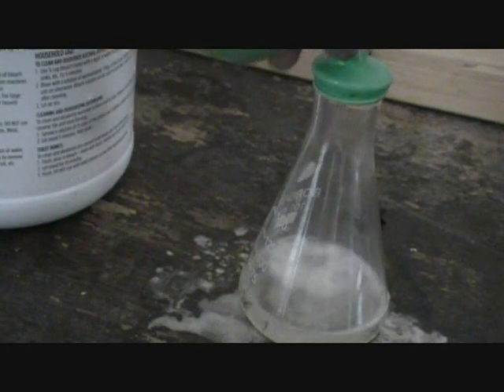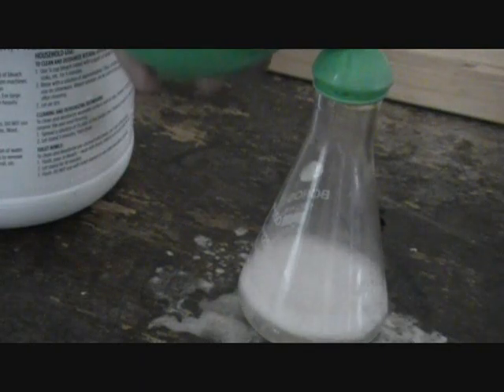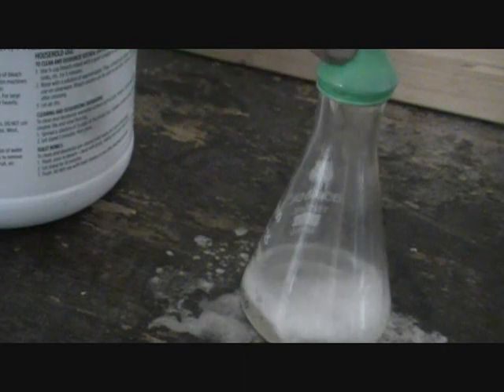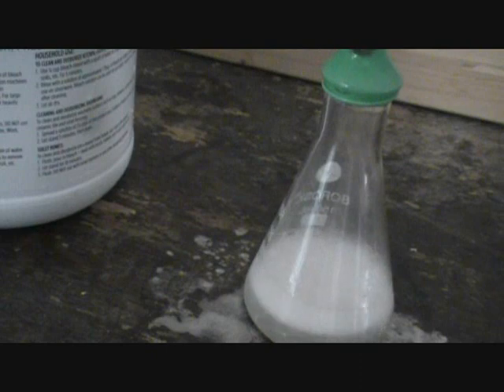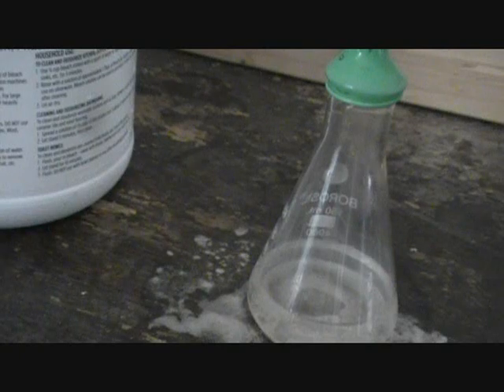You could be doing this, but put it in slowly. This is oxygen. It's not helium, not whatever else you might think it is. It's oxygen.